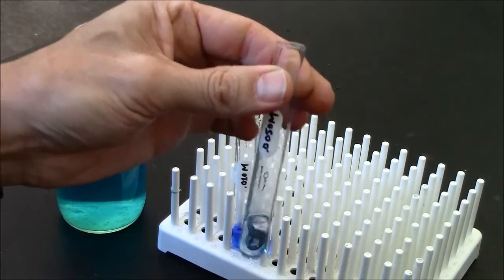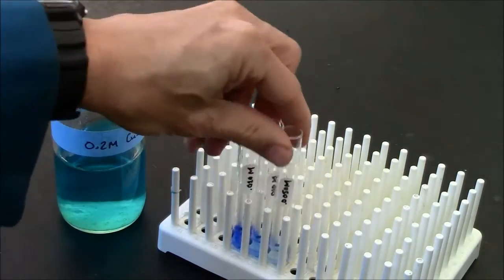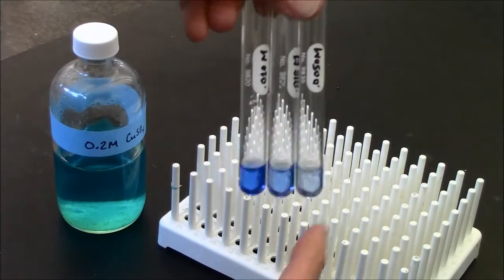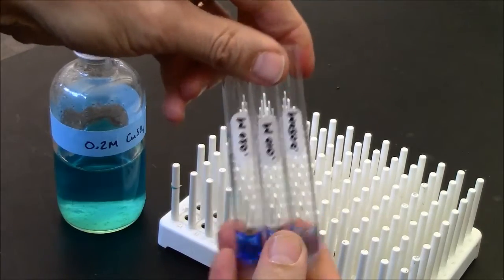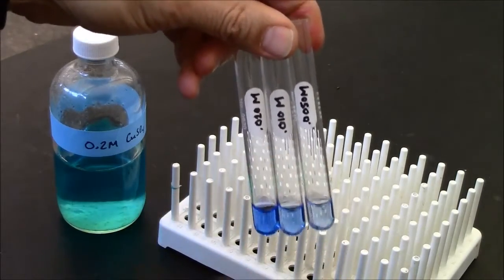And I will leave these out as a standard of sorts. You can see the color lineup that is dependent on the concentration of the copper ions in the solution.